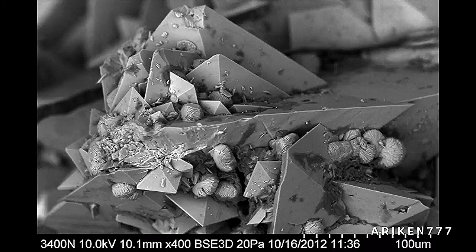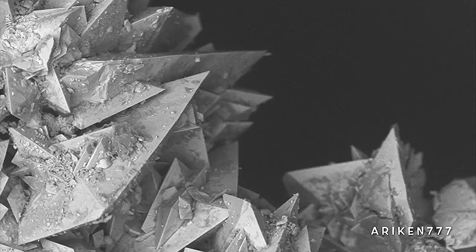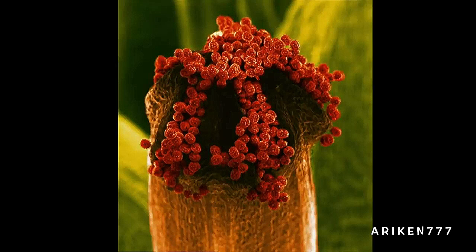A close-up of kidney stones that are usually formed by the precipitation of the mineral salt calcium oxalate from the urine. The resulting hard, round stones may cause severe pain, especially as they pass down the urinary tract. Large kidney stones may need to be surgically removed or broken down using ultrasound therapy. The bright red pollen of the colt's foot flower.